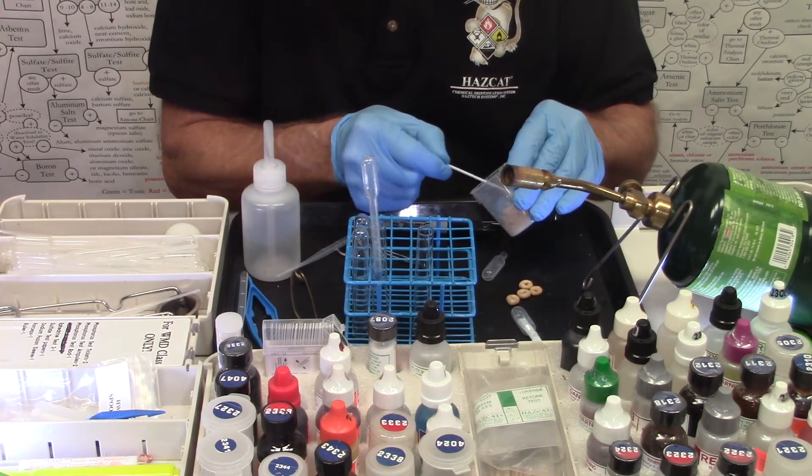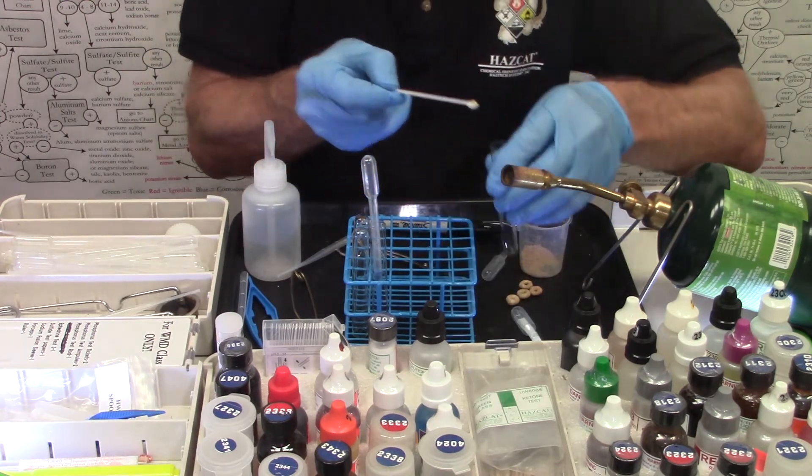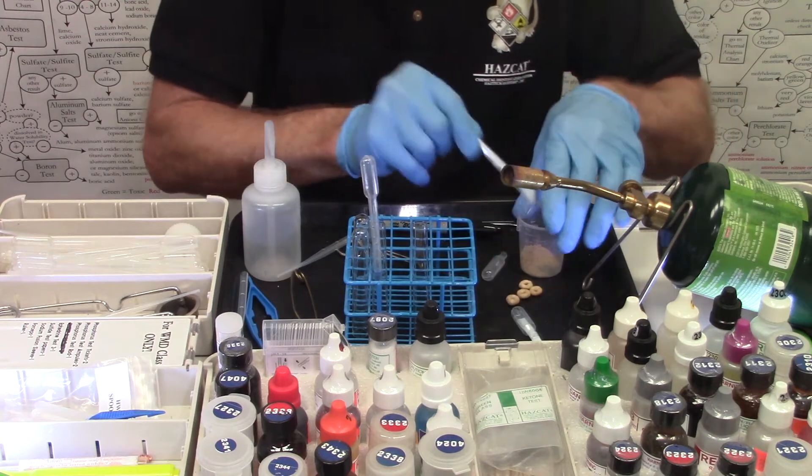I want to make sure that someone's not trying to poison me. I'm going to crush them up a little bit. I'm going to put a half spoonful into the test tube.